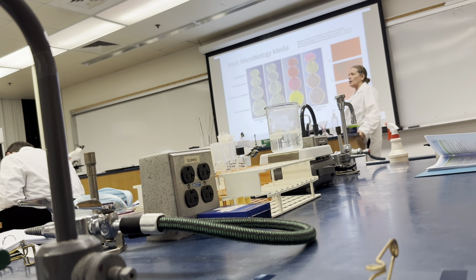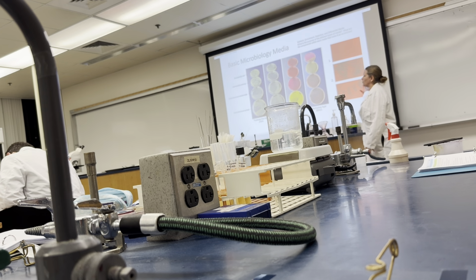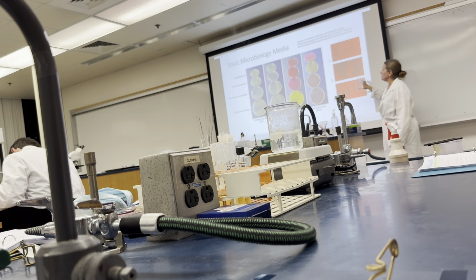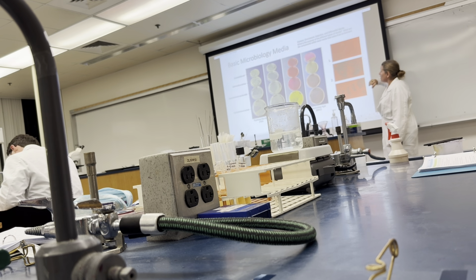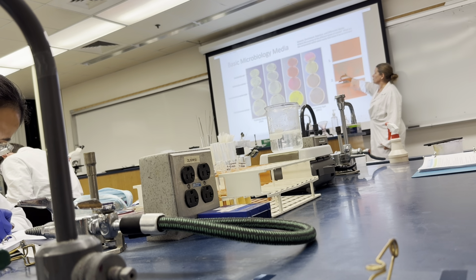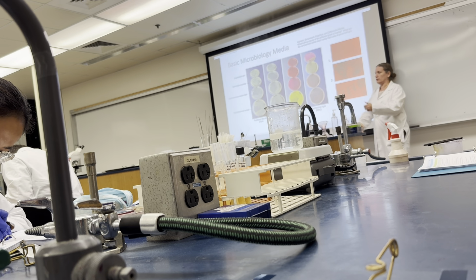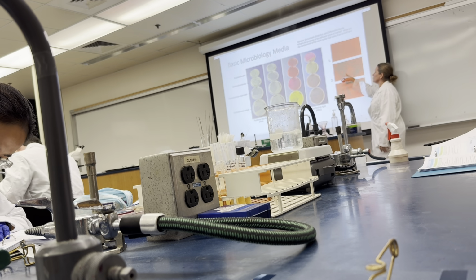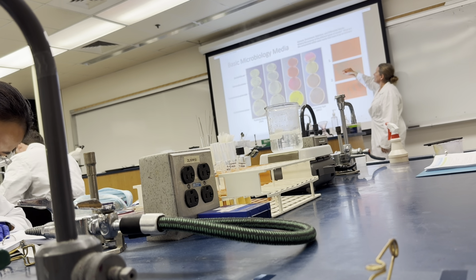Now, this here is actually provided to you. It's obviously the Staph aureus, Staph epidermidis, Salmonella, Escherichia coli for the different media. The only one I don't have a picture of would be the hemolysis patterns, but I have them here. You'll notice this one, you can actually see through the plate. So you see the countertop, and I was probably standing right here while I was holding the plate, taking the picture, okay? So you can see through the plate.